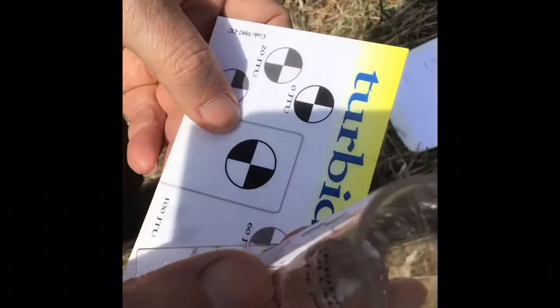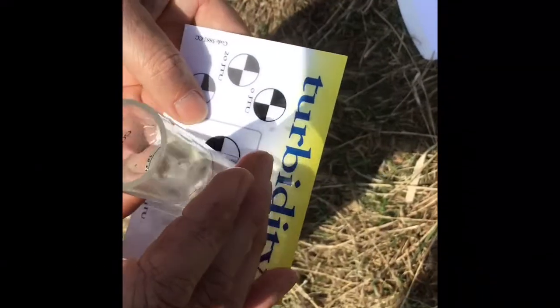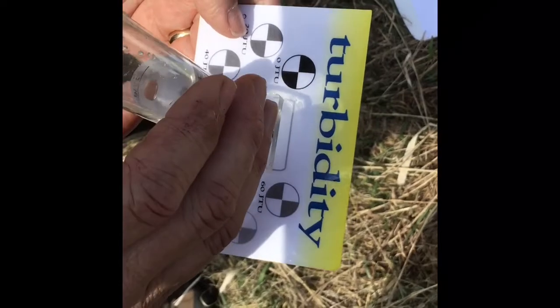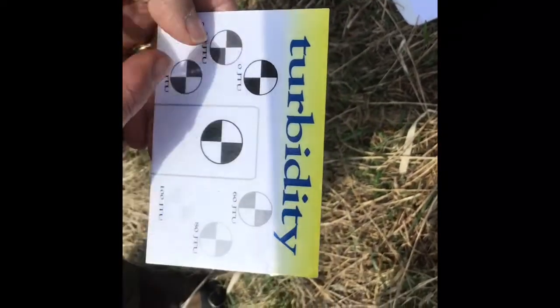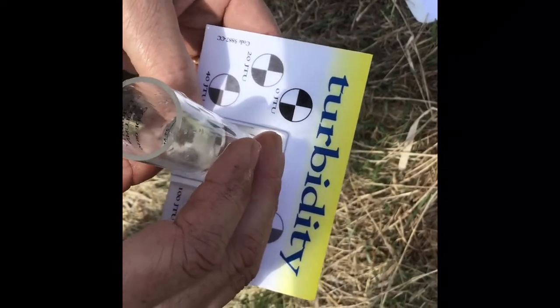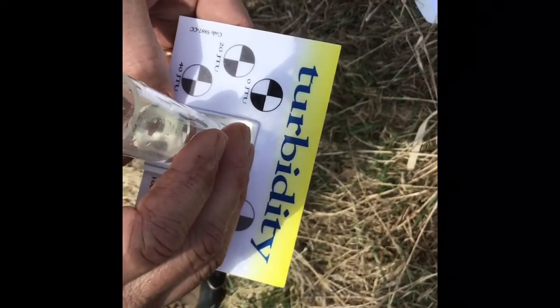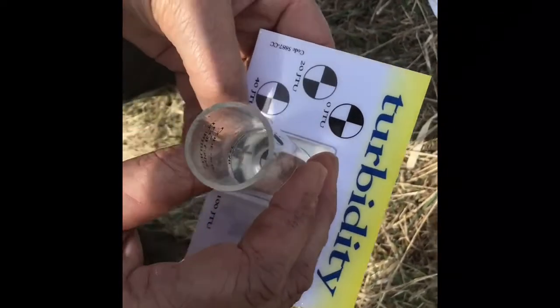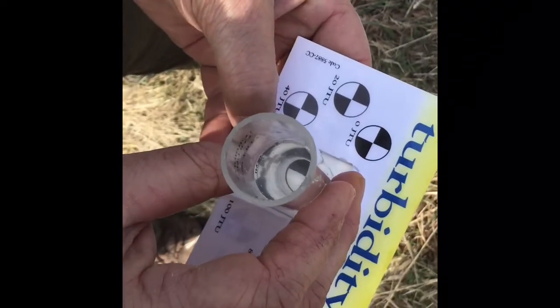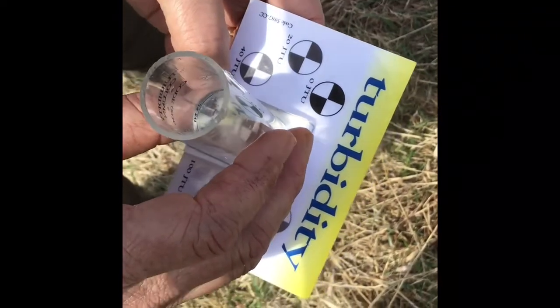What I did was I filled water from the pond up to the 25 milliliter mark, and if you notice these little patterns on here, you put the base of the apparatus down on top, and you look through and match it up with what's given on the outside. So if I put it right there and look through, I can still see the alternating black and white triangles pretty easily. I would say either 0 JTUs or somewhere between 0 and 20, like maybe 10. So I'm going to go ahead and record 10 JTUs, which is actually really, really good water clarity.